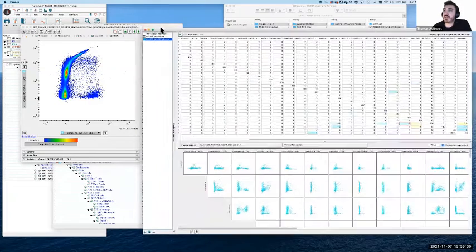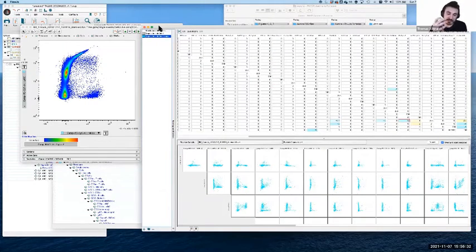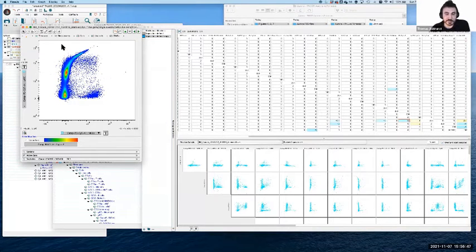You can also deal with it if there's been a problem with the unmixing, where you've not picked the right population, or not a population that's sufficiently high. That can absolutely be addressed in SpectroFlo, in the actual software on the machine, and you can re-unmix it. If that step has been done properly, but as we've discussed before, your control simply wasn't bright enough.